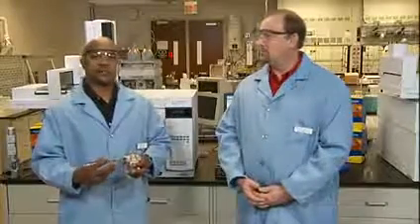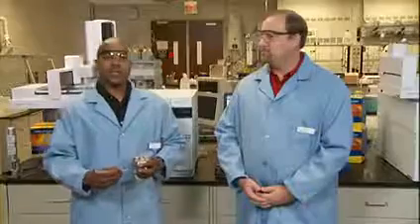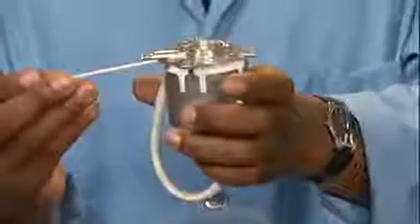The weldment assembly can be cleaned or replaced, especially if you're running pesticides or semi-volatiles. You may find some residual material coats the weldment. You want to clean it to minimize the inlet activity. You don't have to remove the inlet to clean it. I just removed it for this example. First, you would have to prepare the inlet by removing the column from the bottom, the inlet consumables from the top, and disconnect the split line over here.